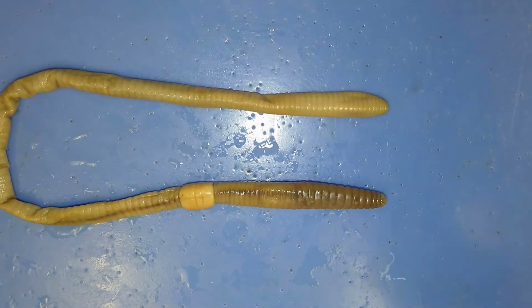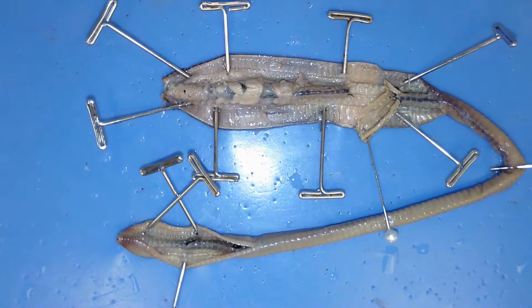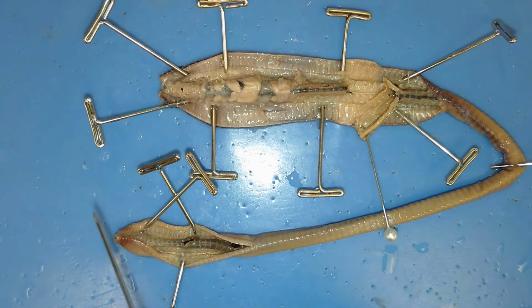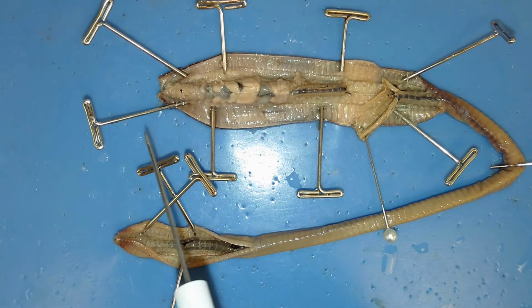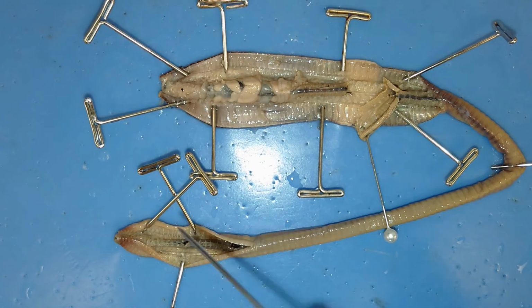With that, I'll bring over the dissection that I made earlier today. So from here, I'll talk about internal anatomy. I'll cover a couple different groups or systems. More specifically, I'll cover the digestive system, the circulatory system, the nervous system, and the reproductive system of this organism. So if you look closely, you should be able to see some very well-defined organs, especially of the digestive system.